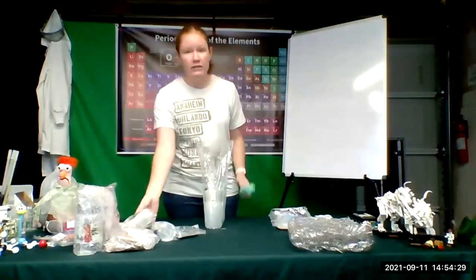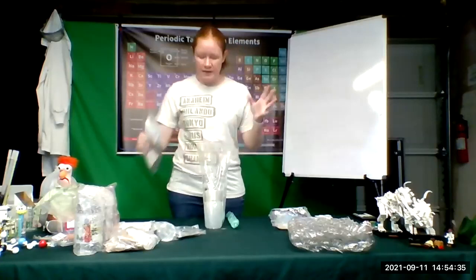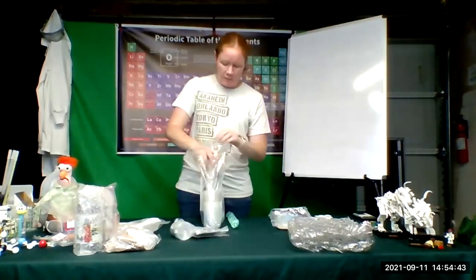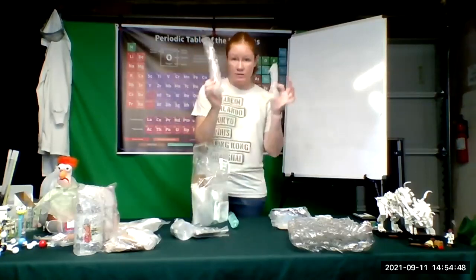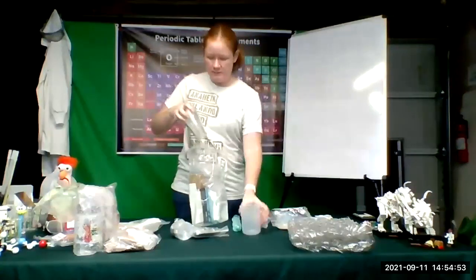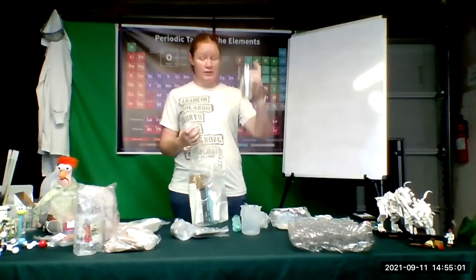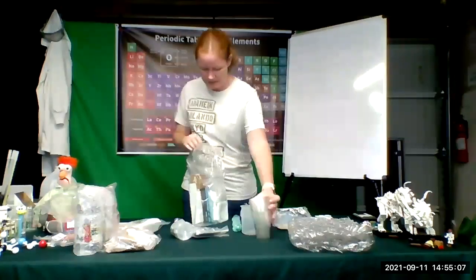So for some of them you'll have other stuff supplemented, like our investigating chemical reactions comes with some tubing and a bigger test tube. So sometimes you'll supplement with stuff, or here our copper single replacement reaction has a funnel with it. But a good portion of your experiments will be using what's inside this kit. So we've got some graduated cylinders, thermometer, beaker, some plastic cups. So even though these are just plastic cups, these are reusable. So make sure when you're done with your experiments, you don't throw these away. You'll reuse these.